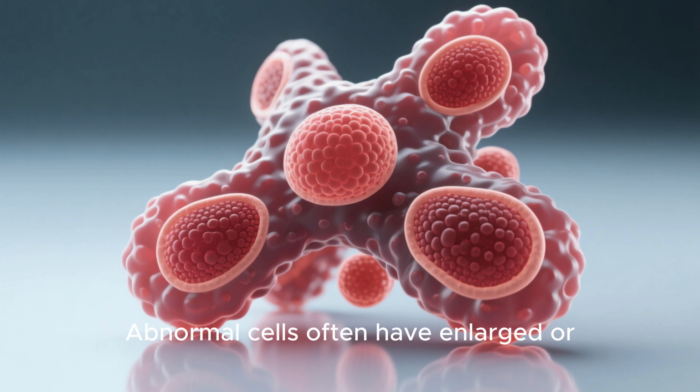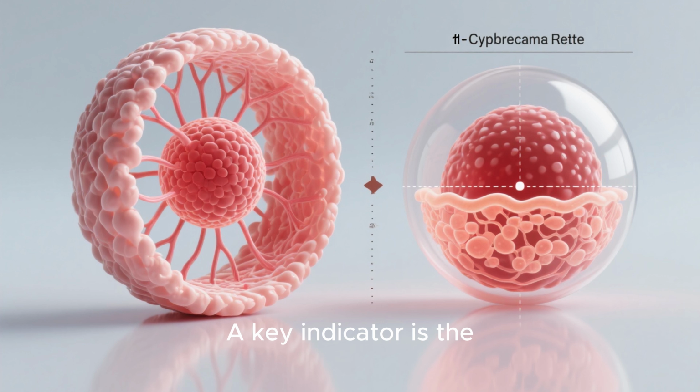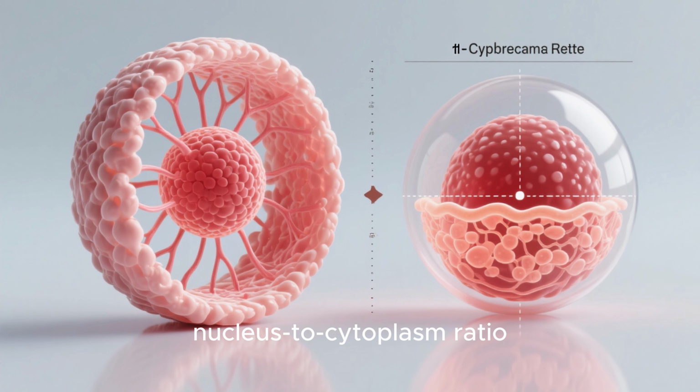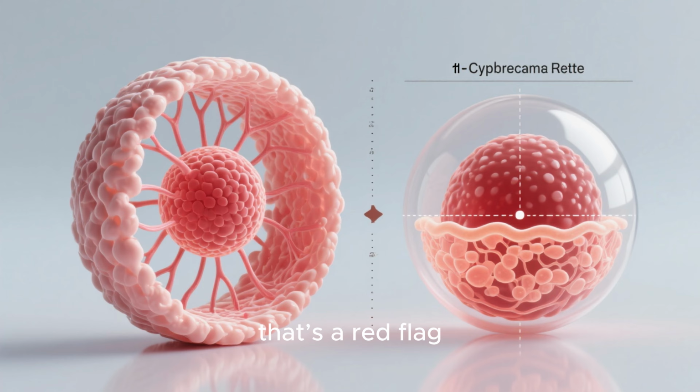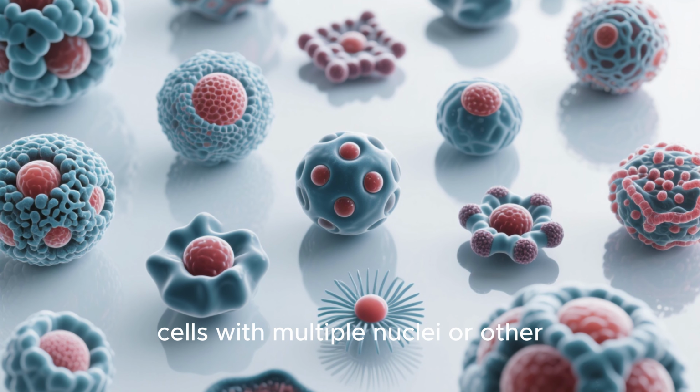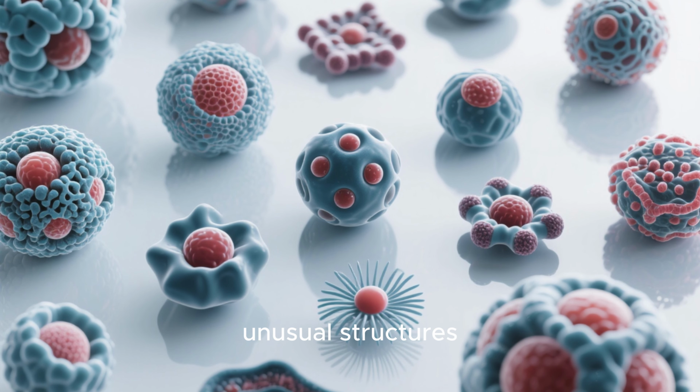Abnormal cells often have enlarged or irregularly shaped nuclei. A key indicator is the nucleus to cytoplasm ratio. If the nucleus looks too big for the cell, that's a red flag. You might also see cells with multiple nuclei or other unusual structures.